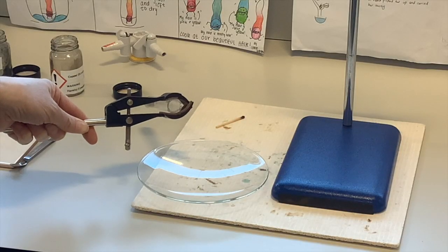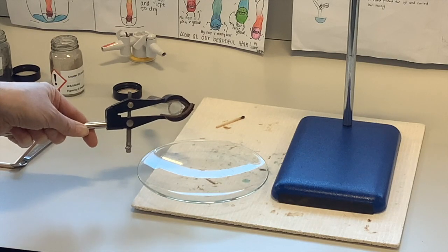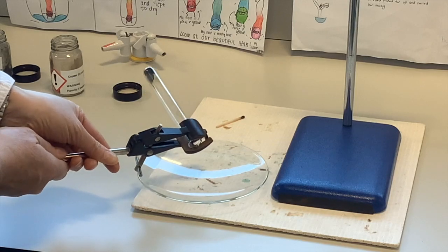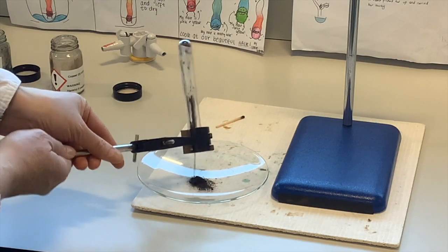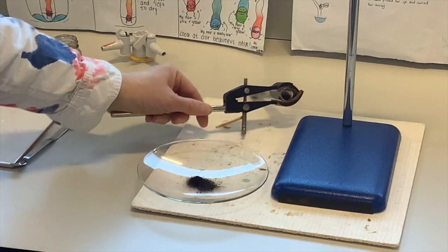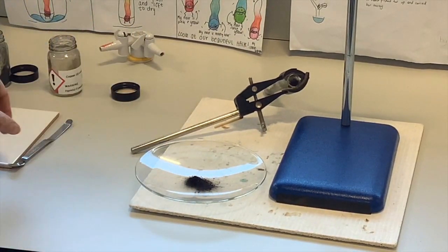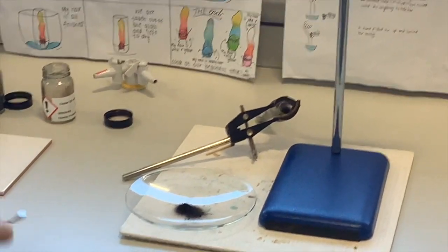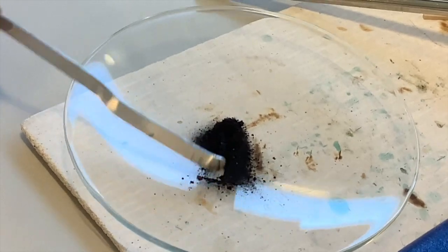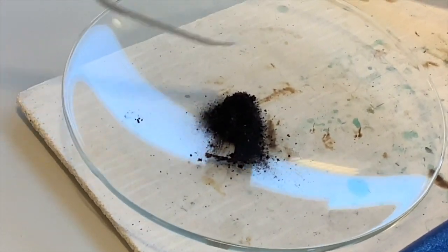So third form, I'm now going to tip out the contents of the test tube. I'm holding it still in the clamp because it's going to be really hot. I don't want to burn myself. So if we tip this out onto this watch glass, and when we do this, it's like digging for, well, it's not gold, it's copper. But I'm going to use the spatula. I can see little flecks of red-brown copper in that.